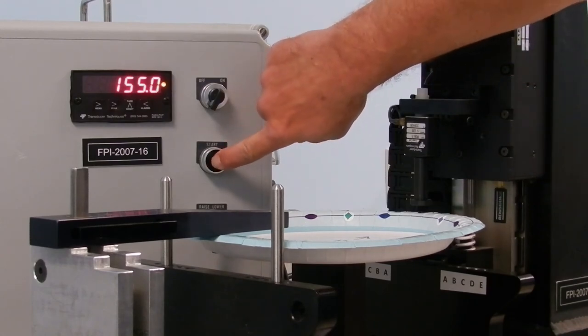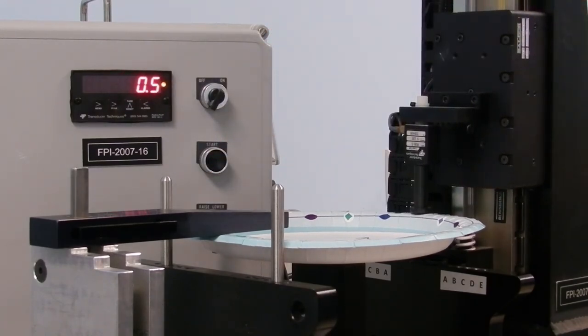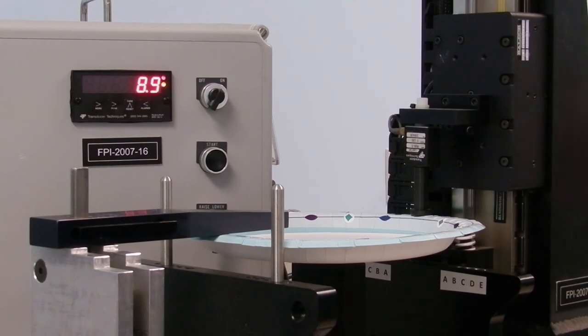The pressure arm is lowered onto the right side of the plate. The pressure is stabilized to establish a baseline at a point where the plate is level.